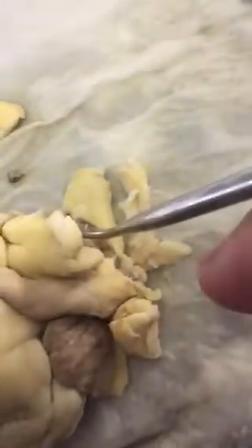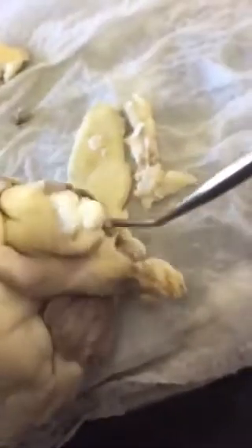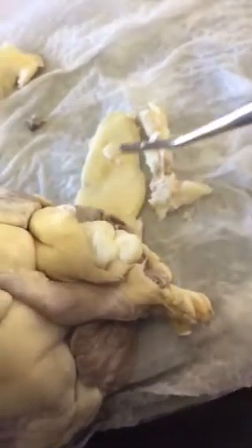The carotid would be one of the smaller next to the aorta, just the aorta arch, which is right here. And the brachiocephalic artery is even smaller. My specimen's not cooperating. Here.